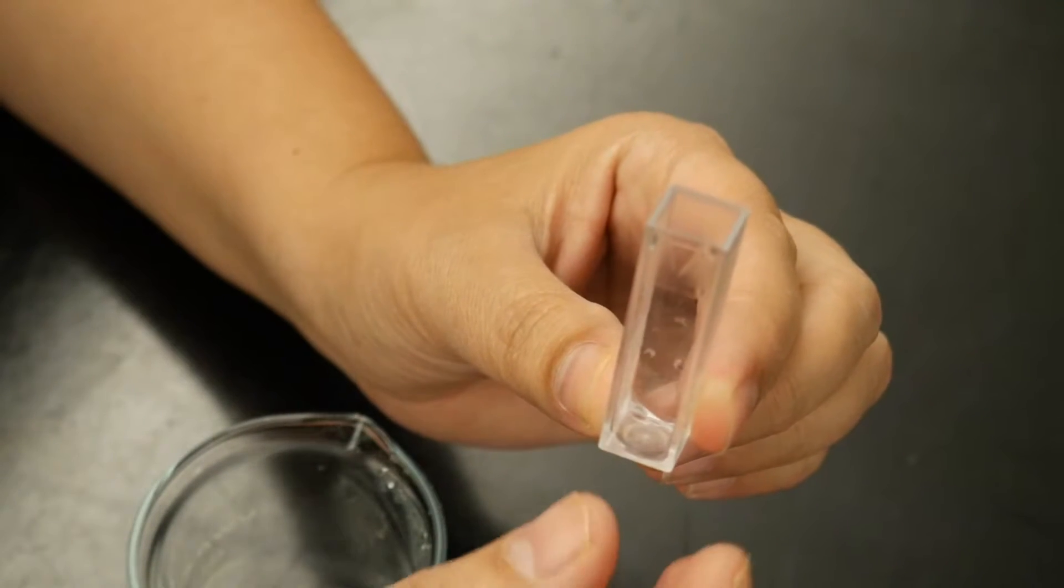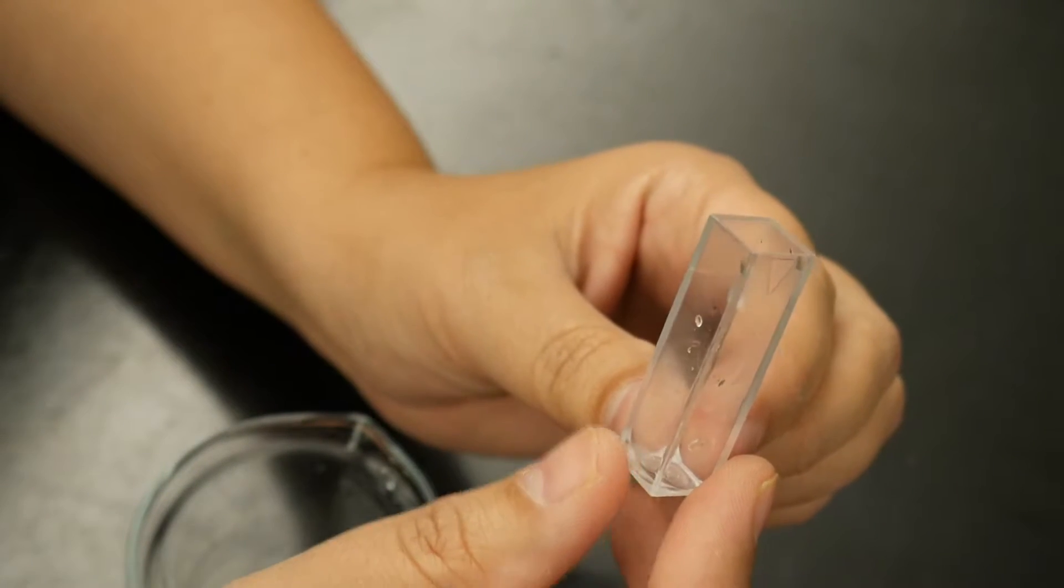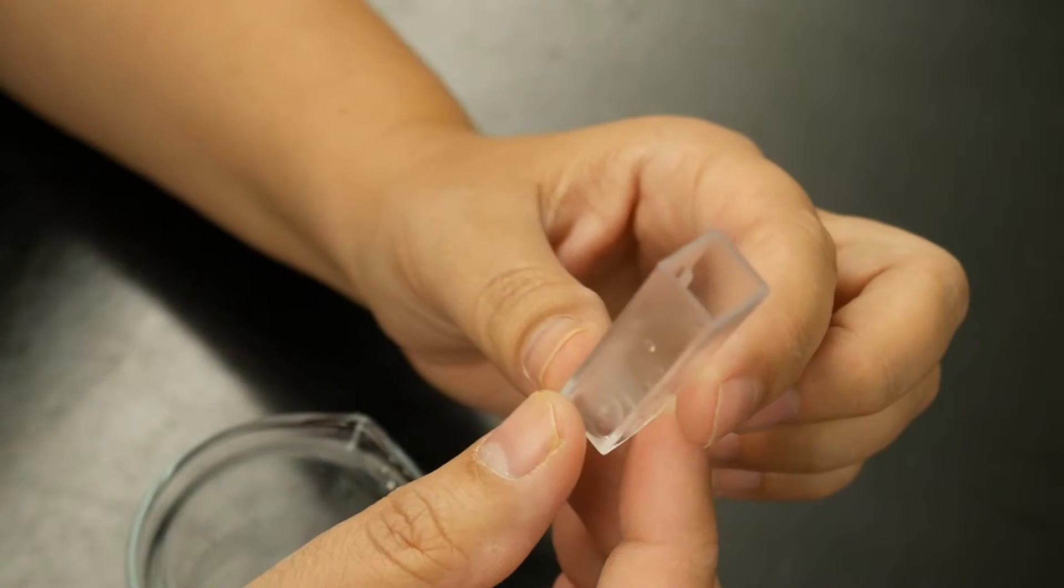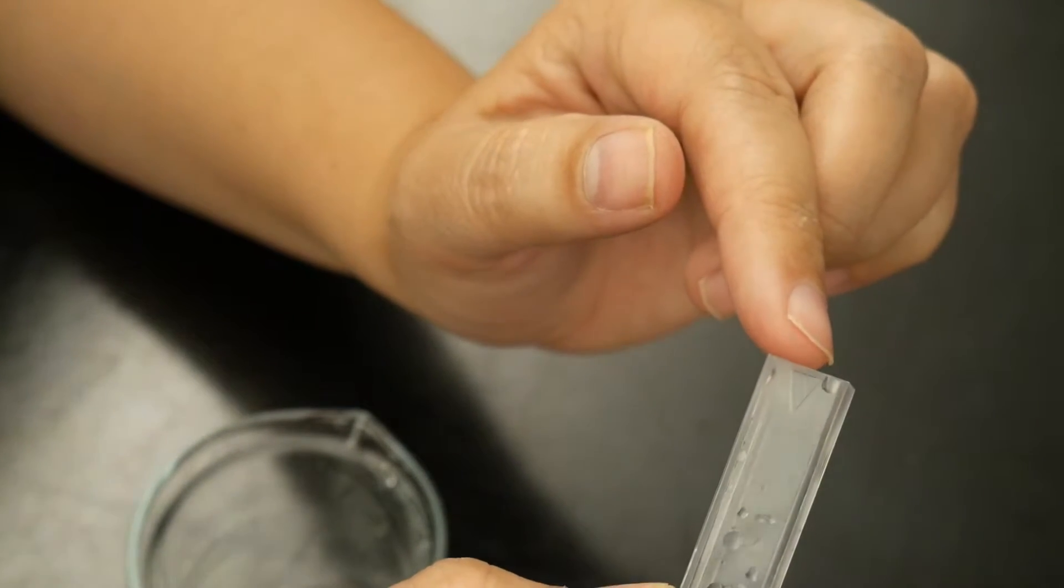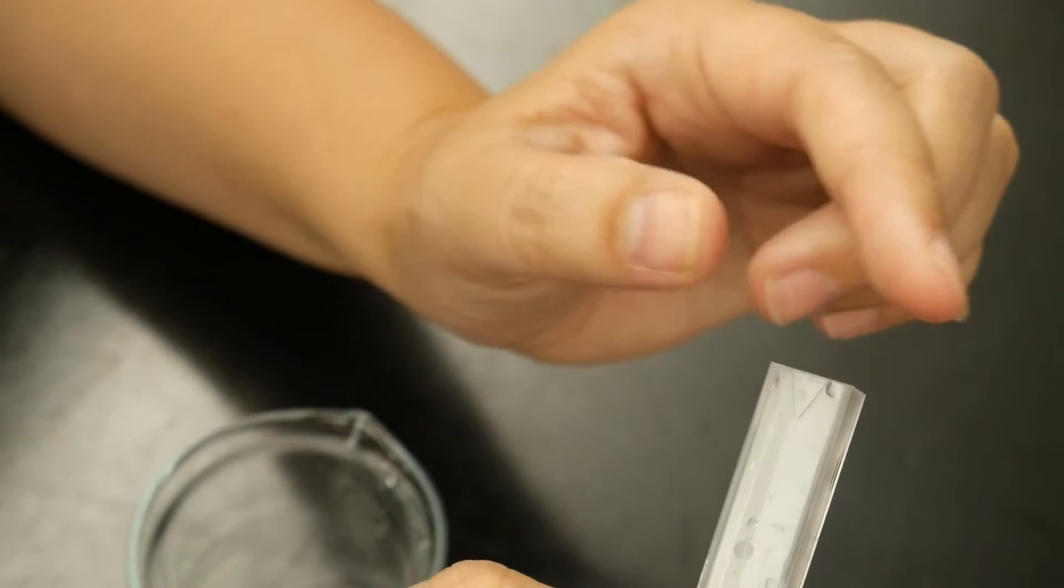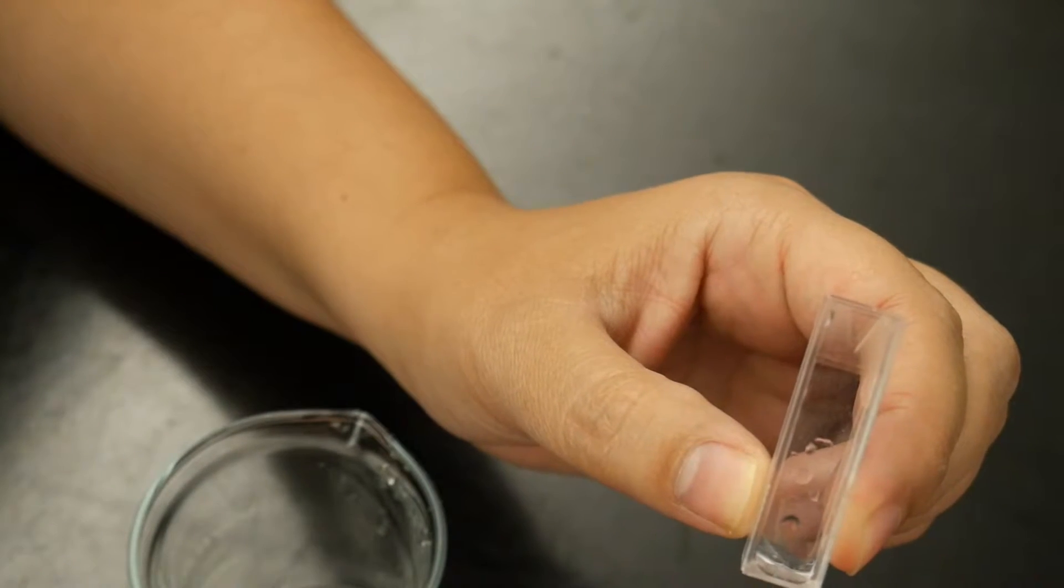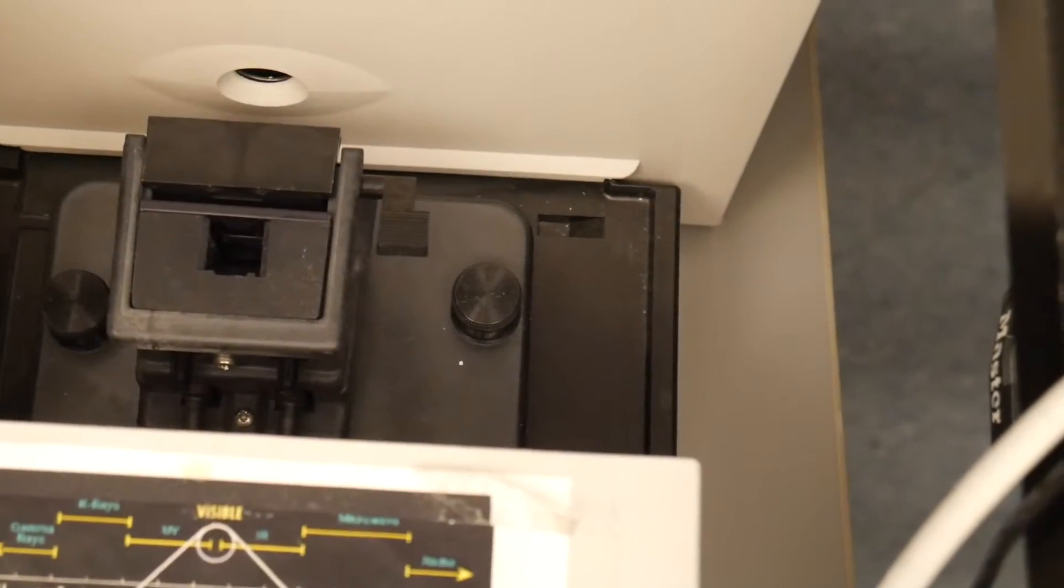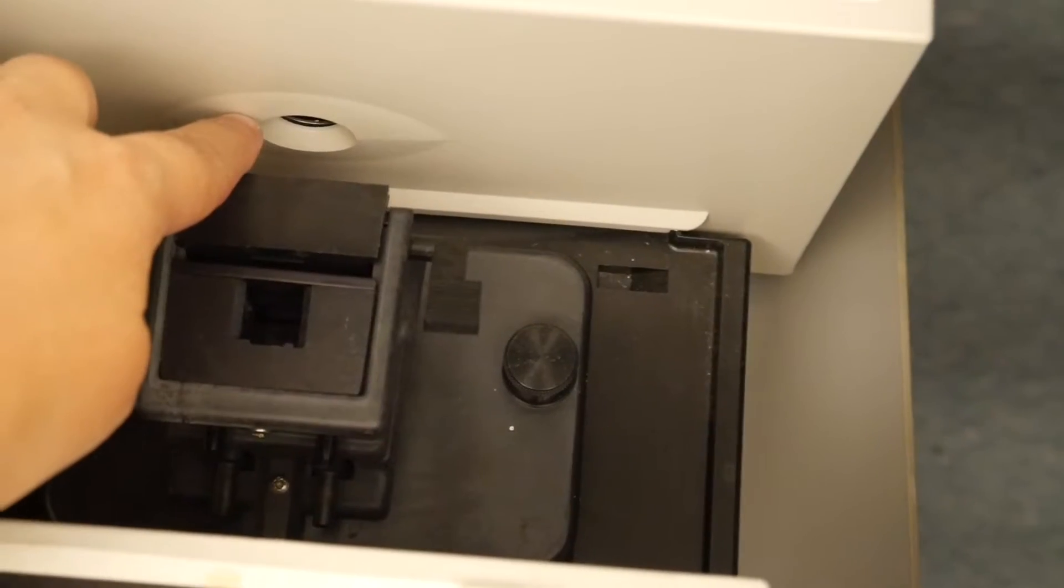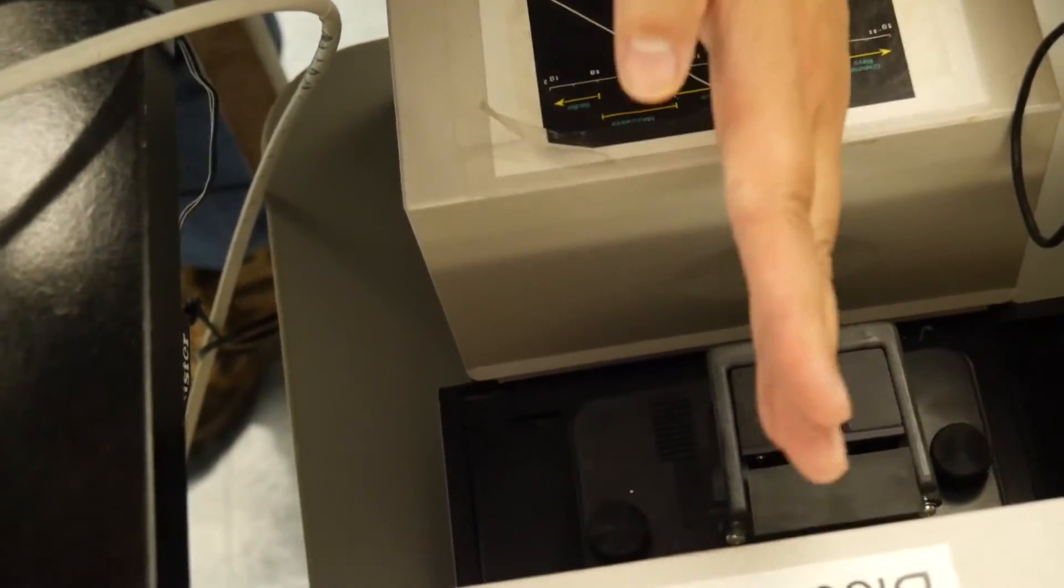One of the things that all of the cuvettes have in common is they have one side that is meant for light to pass through and one side that isn't. So in some cases, the side that is not meant for things to go through is very obviously frosted and opaque. In this particular case, there's a little arrow right here that indicates this is the side you want to put facing the light path. So it's very important that you look at your instrument and figure out where the light path goes. That is going to depend on which of our instruments you have. So usually what you're going to want to do is you're going to want to identify where the light path goes. So you can see right here, here's an opening where the light is going to come through. And if we move around this way, you can see there's the other path. So the light is going this way through the cuvette.